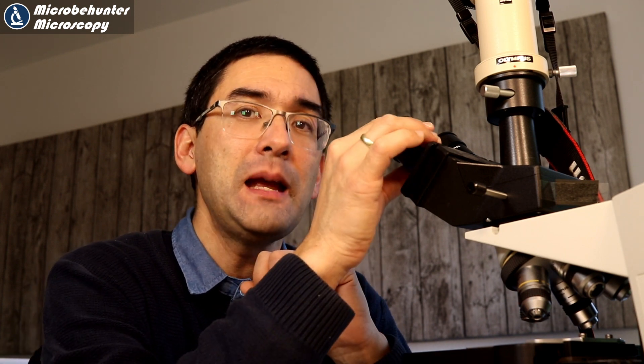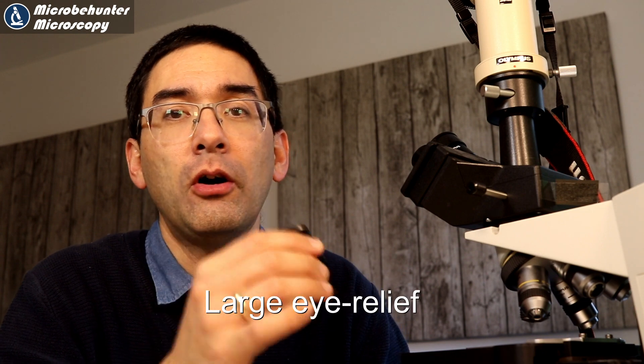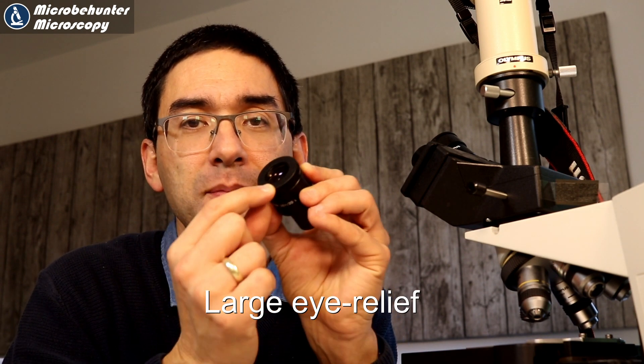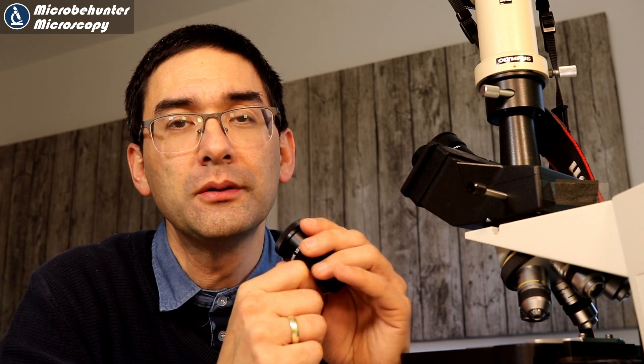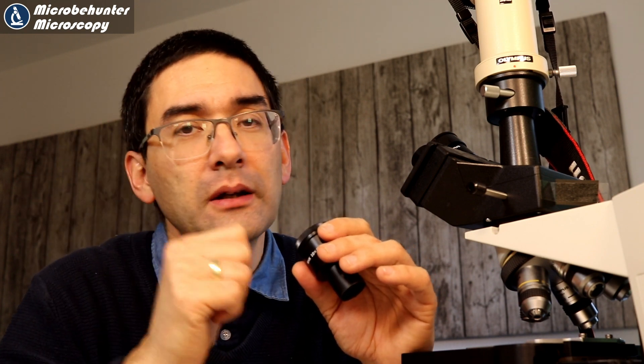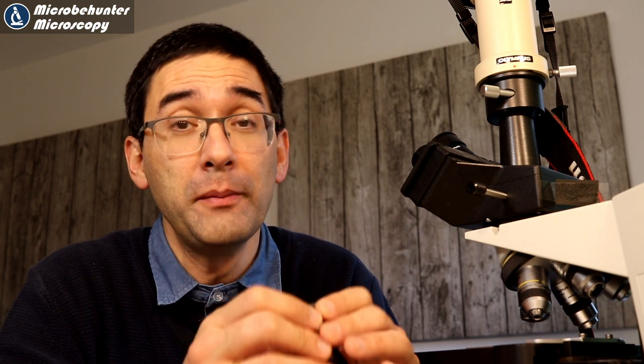There are certain characteristics that all research microscopes share, and it is not image quality. The first point: if I were to buy a good research microscope, I'd make sure it has eyepieces with a large eye relief. The eye relief is the distance between the front lens and the place where your eye is. If the distance is large, I can still wear my glasses, look through the eyepiece, and still get a full picture — I do not want to take my glasses on and off all the time. In research, I'd be working many hours behind the microscope, so I want a microscope that is ergonomical and not tough on my eyes, and one which is convenient and comfortable to use for many hours. Eyepieces with a long eye relief serve that purpose.